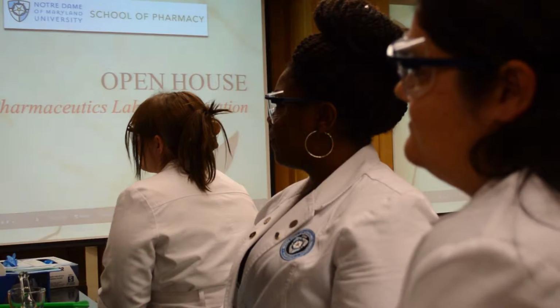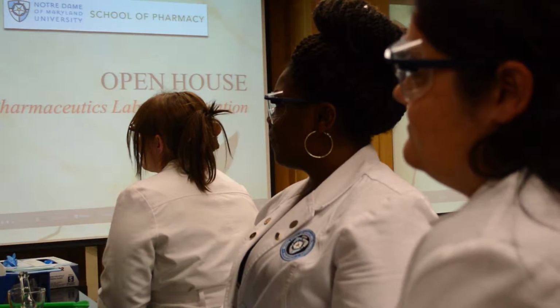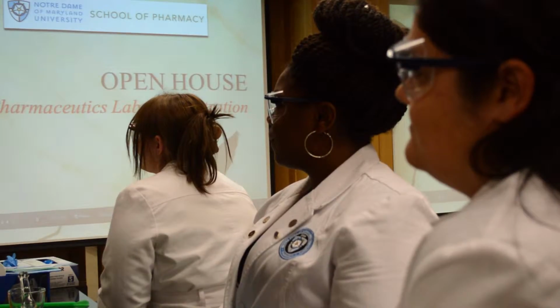They are very hard to make into a powder for mixing with other ingredients like ointment bases or other pharmaceutical bases. If you can form a eutectic, which is available as a liquid, you can uniformly mix it with other emulsion bases, pharmaceutical bases, ointment bases, etc.